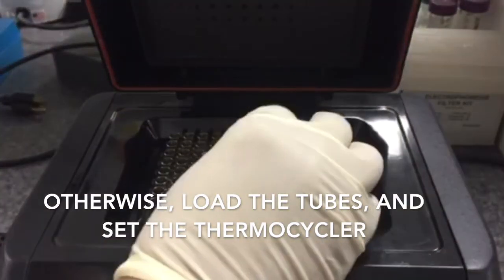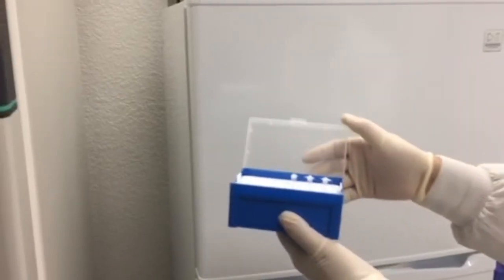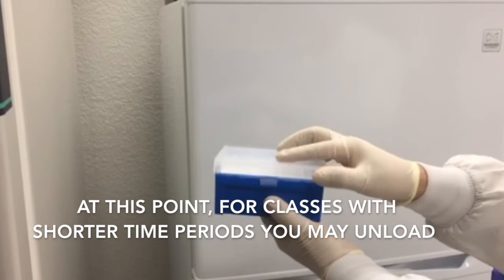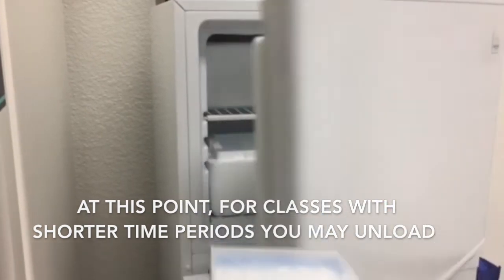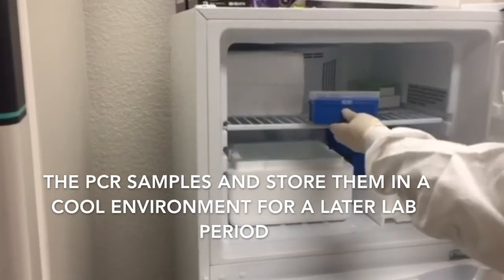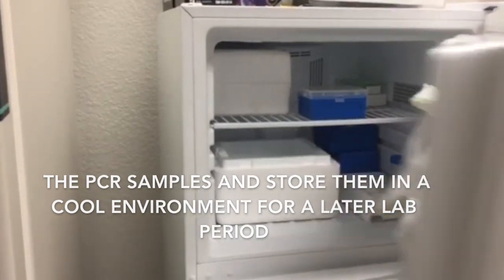Otherwise, load the tubes and set the thermocycler. At this point, for classes with shorter time periods, you may unload the PCR samples and store them in a cool environment for a later lab period.